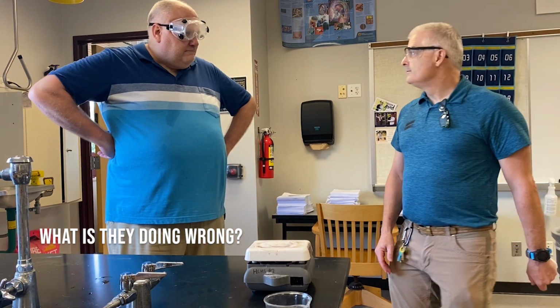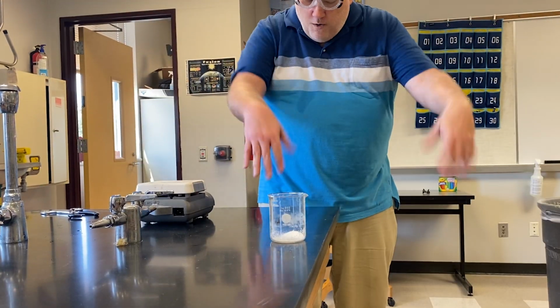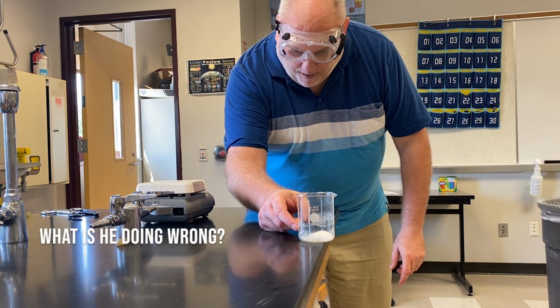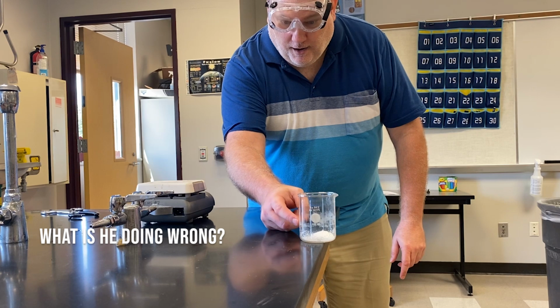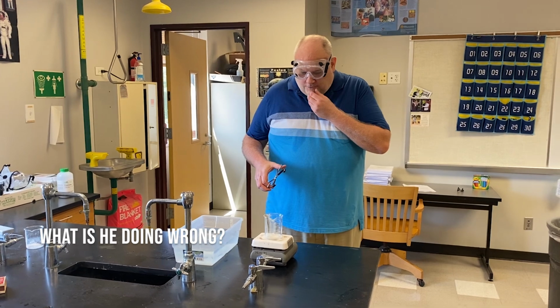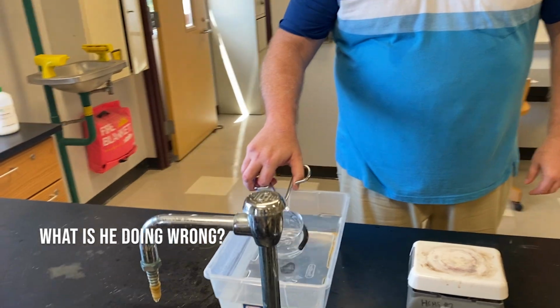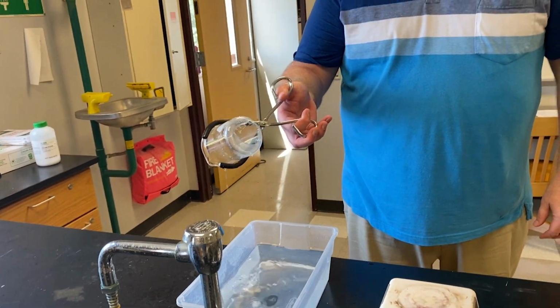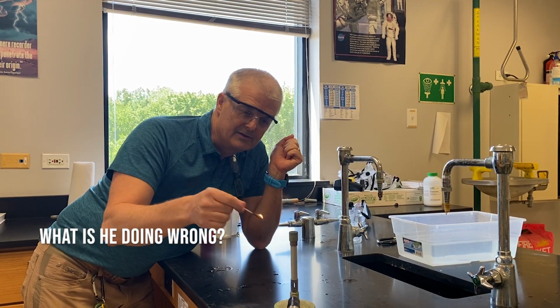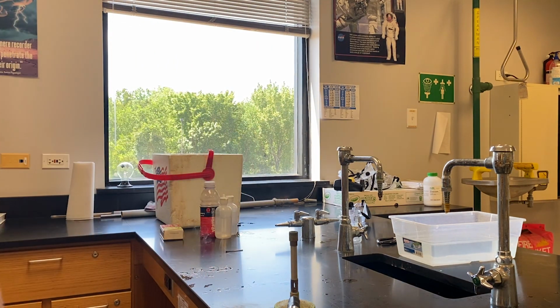Hey, Mr. Bergmann. Is it time to weigh it? Yeah, I think it's time to weigh it. Wonder what the quickest way is to cool this. I bet you if I just took this and put it directly in the water. Oh, oops. Fail. Oh, I so love playing with fire. Well, you know. Let's go to lunch. Yeah, let's go to lunch.